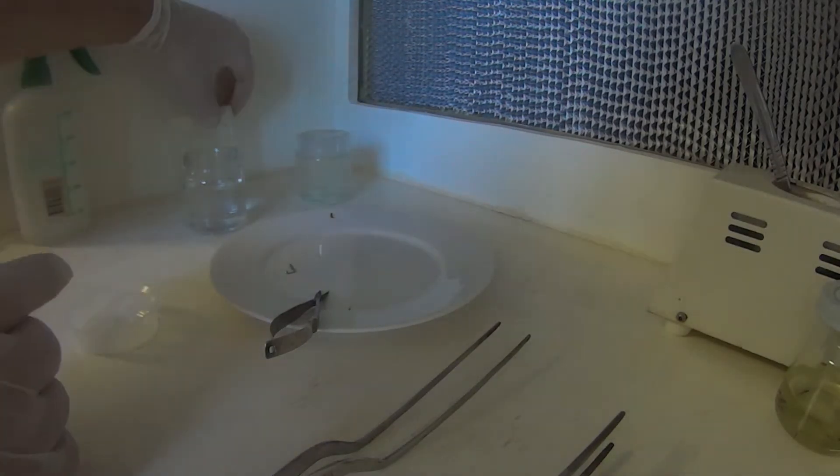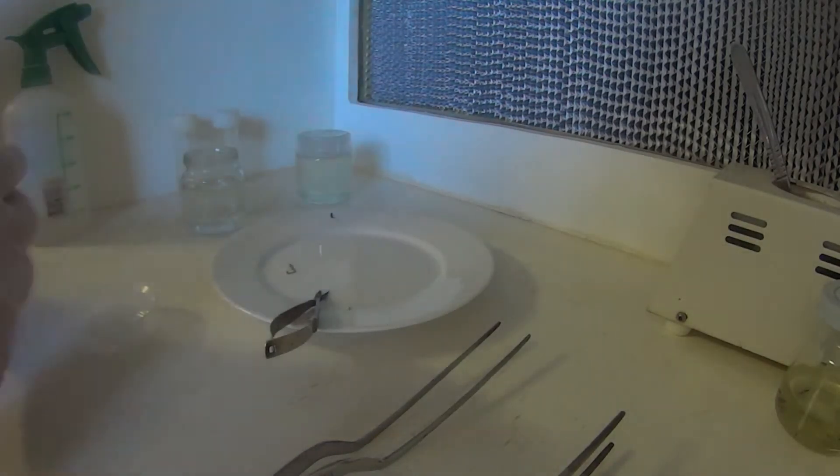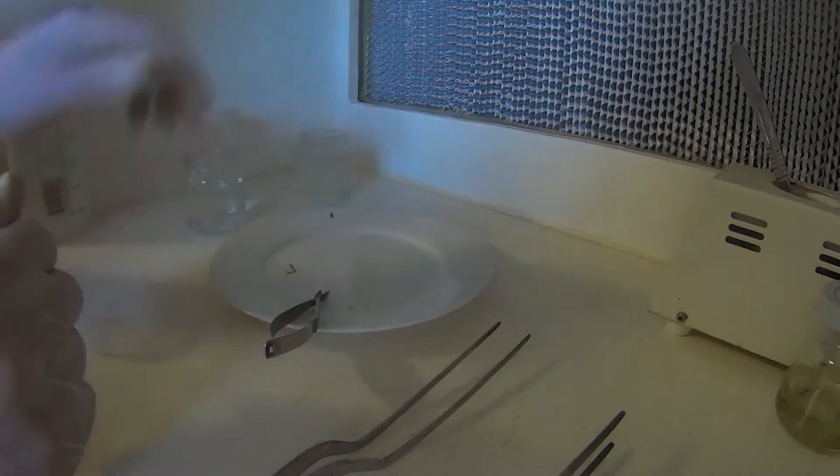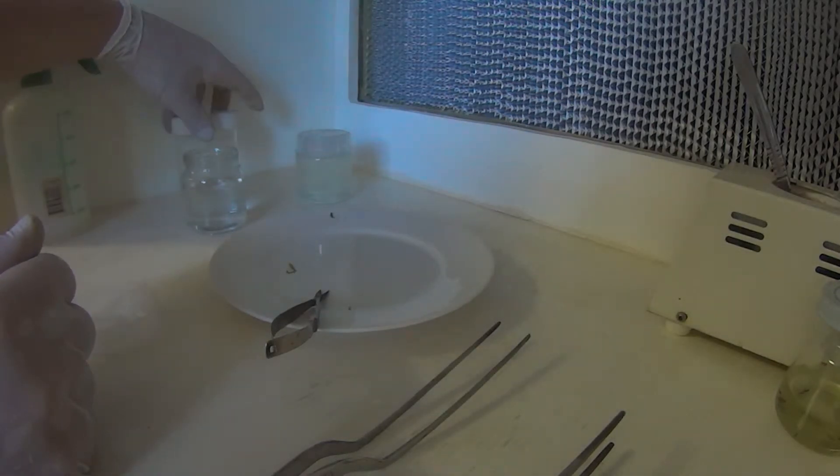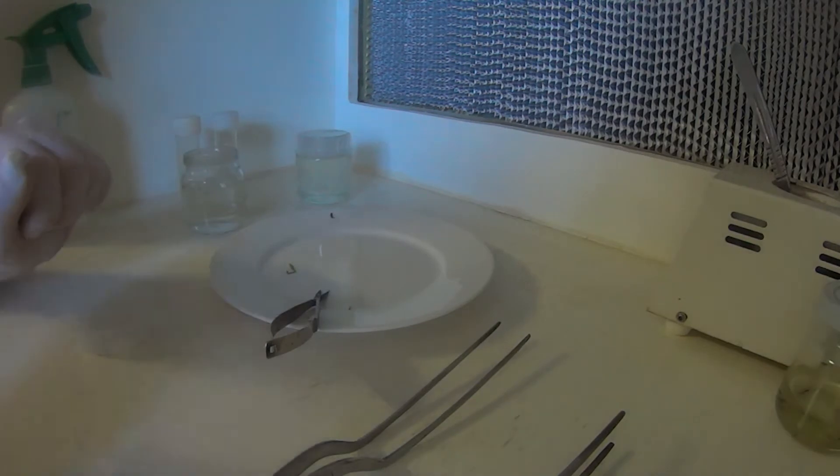Hopefully that's nice and sterile in there. We'll see in a week or so. We've either got sterile tissue, or we have a colony of some sort of spore or bacteria growing in there. We'll soon find out I suppose. And that's it.